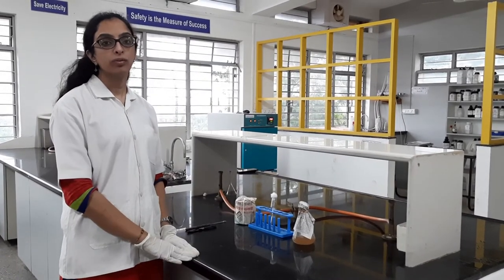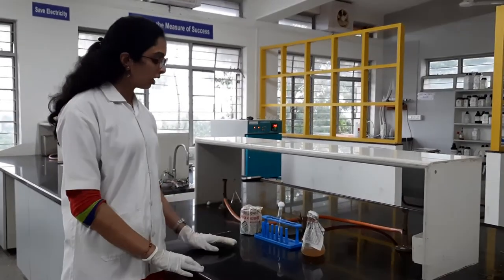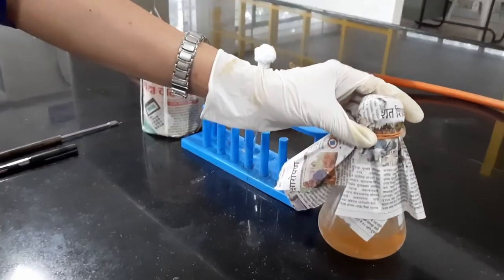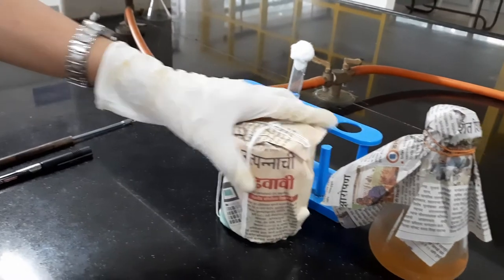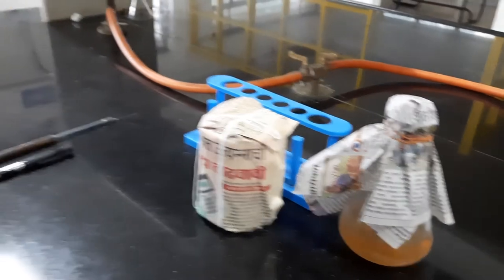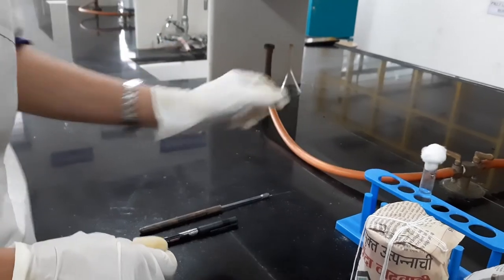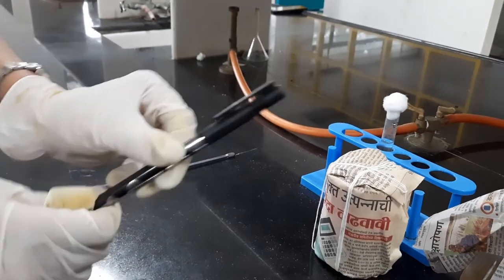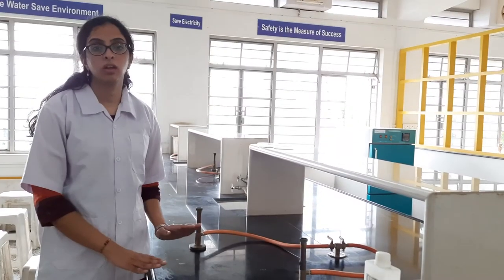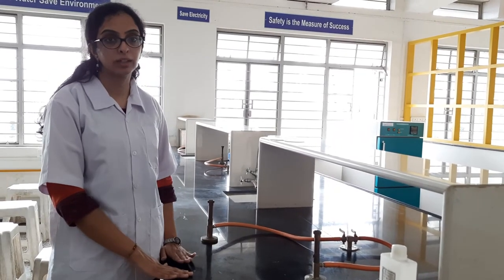Now we will see how to perform the streak plate technique. The requirements are: nutrient agar which has been sterilized, petri plates which are also sterilized by autoclave, bacterial culture of E. coli, marker, and nichrome wire loop.